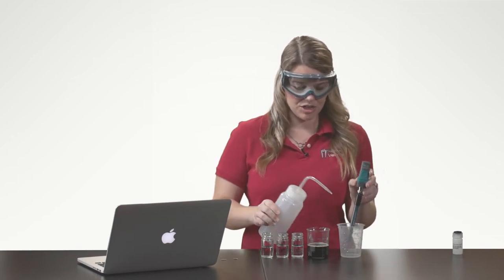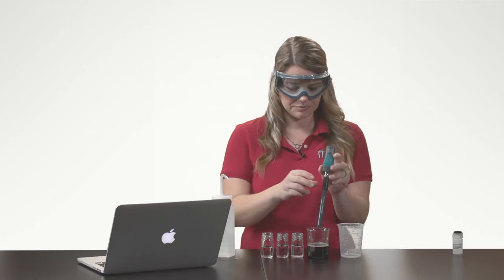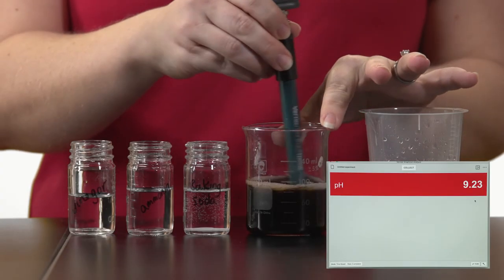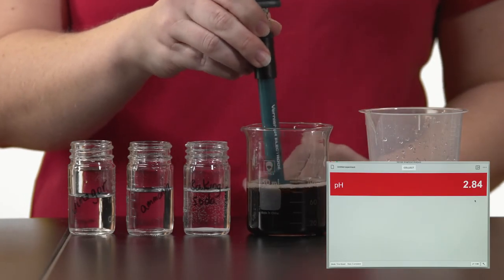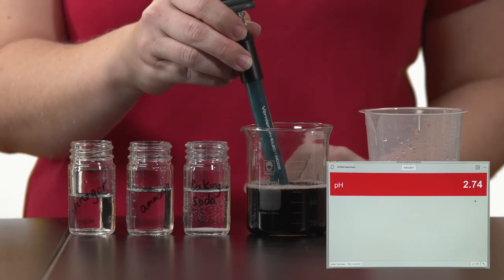The next solution I want to measure is a soft drink, and I see the pH turn very acidic.